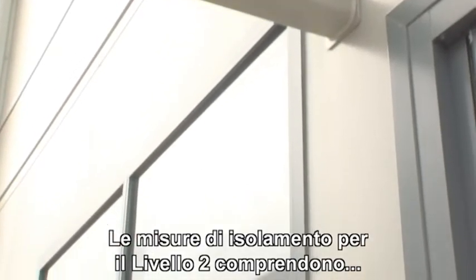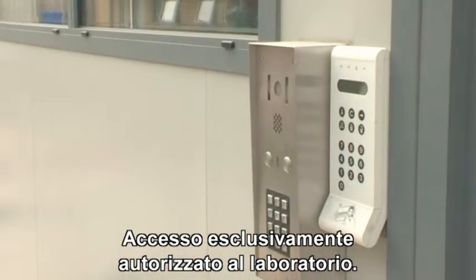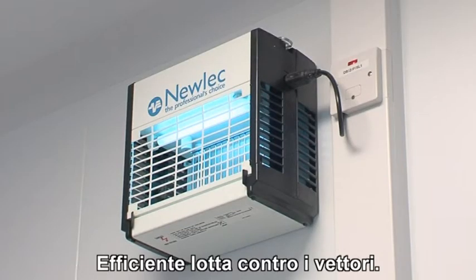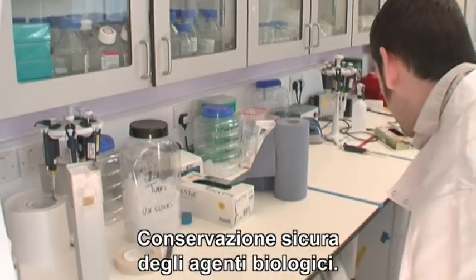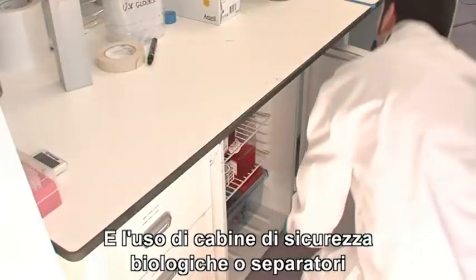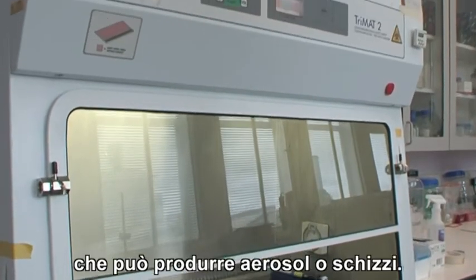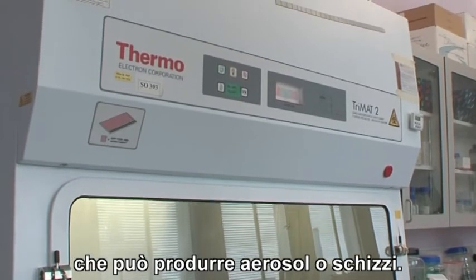The containment measures for Biosafety Level 2 include authorised access only to the laboratory, efficient vector control, safe storage of biological agents, and the use of biological safety cabinets or isolators when handling infectious material that may produce aerosols or splashes.